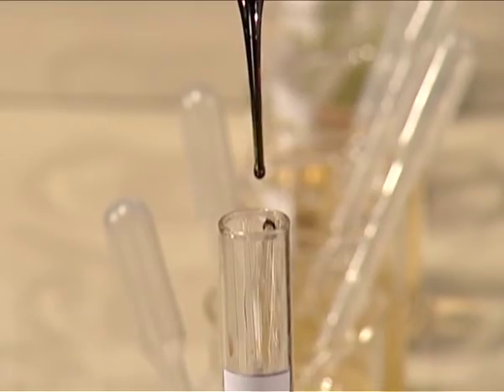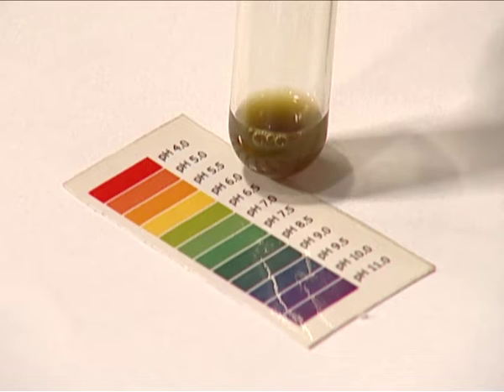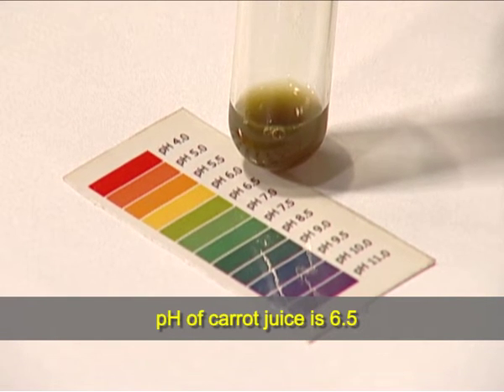Now, I am taking test tube number 6 in which I am adding carrot juice. Now, I am adding universal indicator, mix it thoroughly by shaking. It shows olive green color, matches with the pH nearly 6.5, as you can see easily.